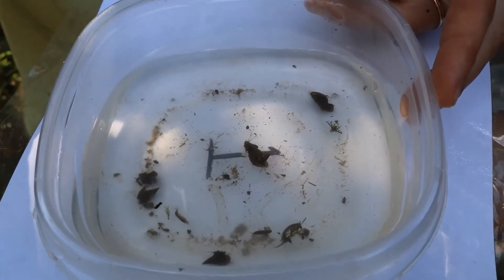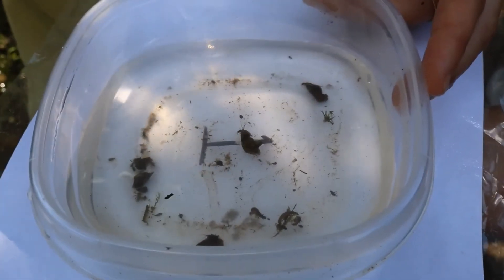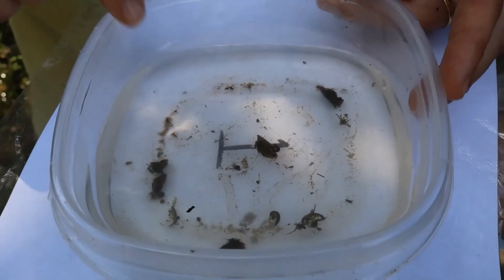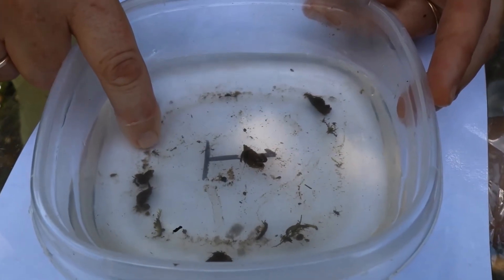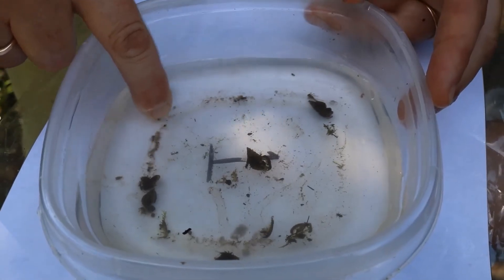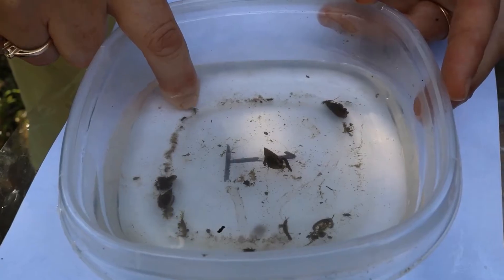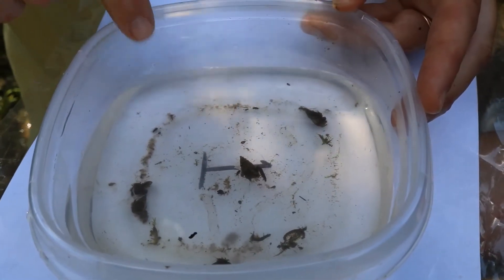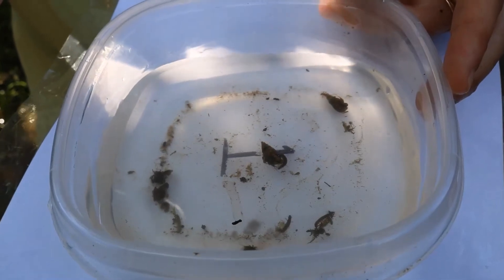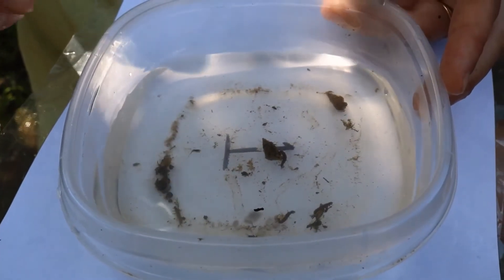There are other macroinvertebrates you'll find like the stonefly — we didn't find one today — but it can look similar; it only has two tails. This mayfly might appear to have only two tails because he lost one. There is one species of mayfly that does only have two, so that makes identification a little more difficult. But you can also tell by how they swim that they are mayflies. Mayflies usually live less than 24 hours after they hatch out, and many species don't even eat — they reproduce and die.